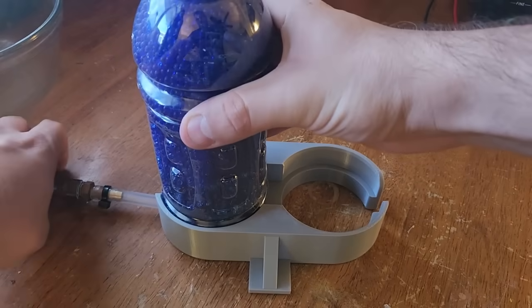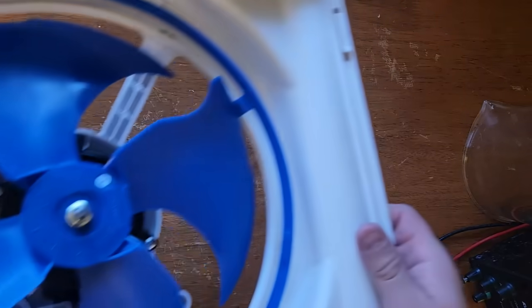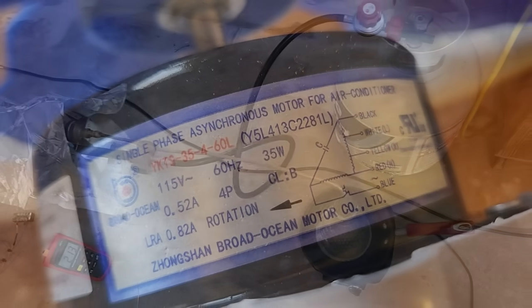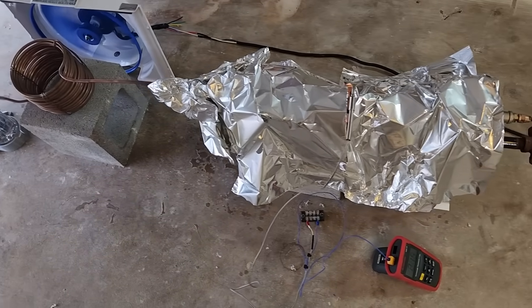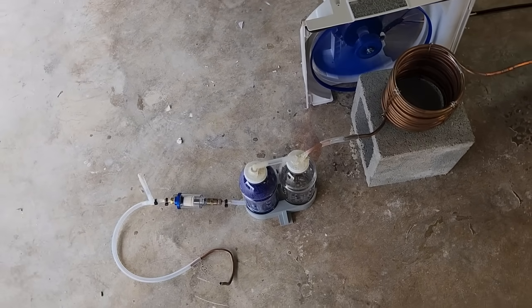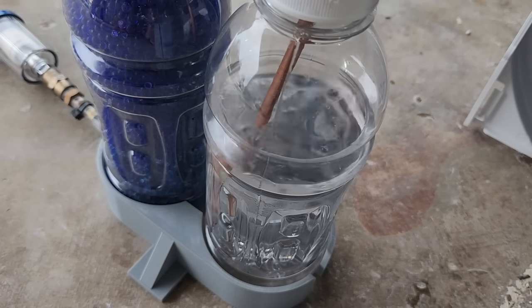I'll have to cool the output in a condenser before I can handle it with these materials, because it comes out of the catalyst pipe around 450°C. I grabbed the 120 volt fan I extracted from a window AC unit in my last video — 35 watts should be plenty of power to keep things cool. I mounted the burner and catalyst pipe in aluminum brackets and covered them in aluminum foil. This helps keep heat in, but its main purpose is to prevent the breeze from extinguishing the flame. On the output, I've got my 25 foot condenser coil from my last video with the 120 volt fan blowing over it, piping into the bubbler dryer filter assembly and out a silicone tube to a length of copper tubing.